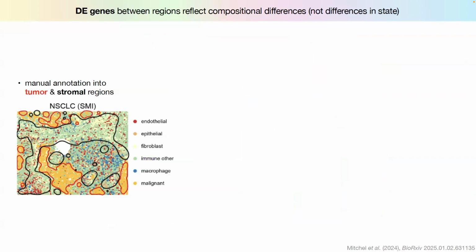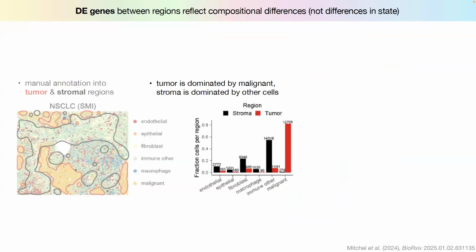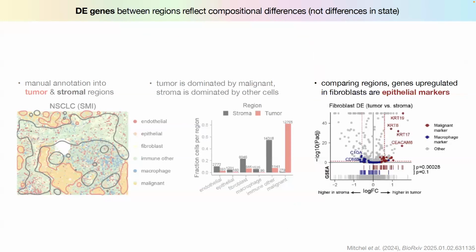And then they show, because of this, again, it's similar to before. If we look at a tissue and we have a stromal compartment with fibroblasts and endothelium and whatever, and then we have a tumor, and we compare these regions, and the tumor region has a lot of malignant cells, now we do differential expression analysis, like the heat map that I showed you earlier. What you get is that the fibroblasts express a lot of keratins. That's what the analysis is telling you. So this is exactly the point from earlier, that your differential expression analysis is being made dirty by the microenvironment of the cell. Whatever the microenvironment of the cell, it will affect your differential expression analysis.